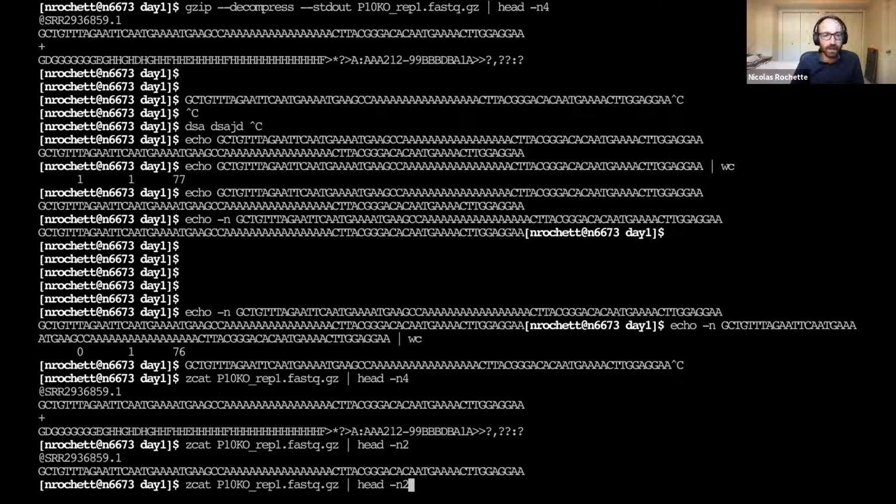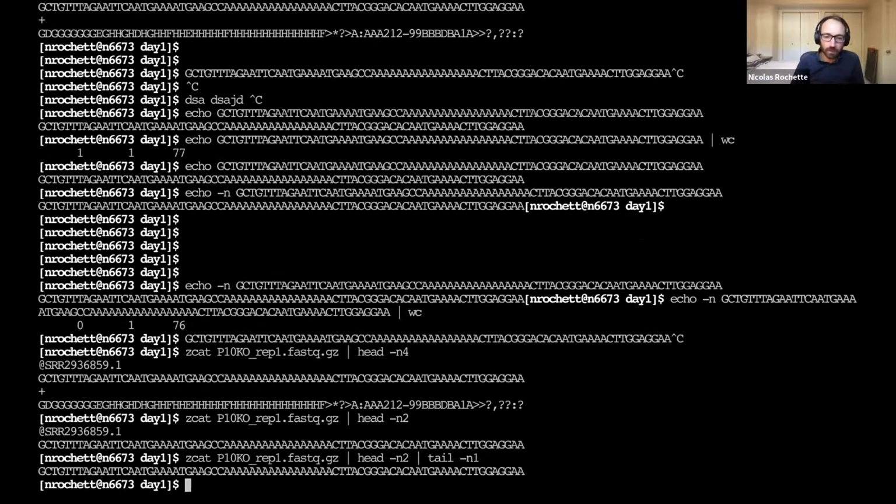And similarly to head, we actually have another command to extract just the last lines of the file.